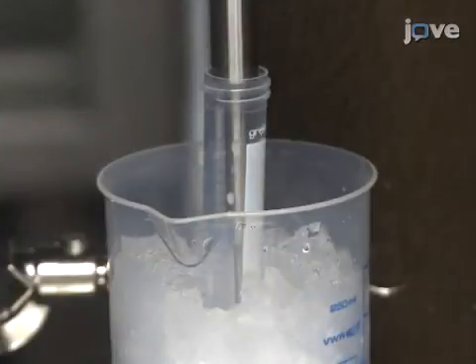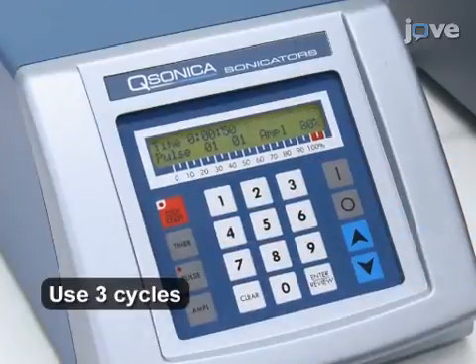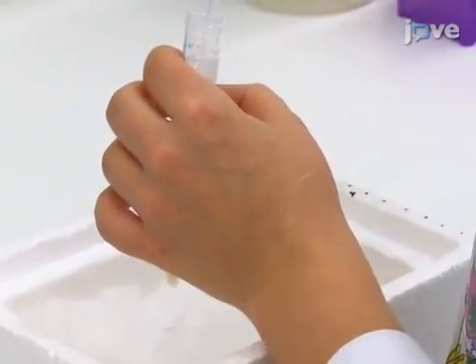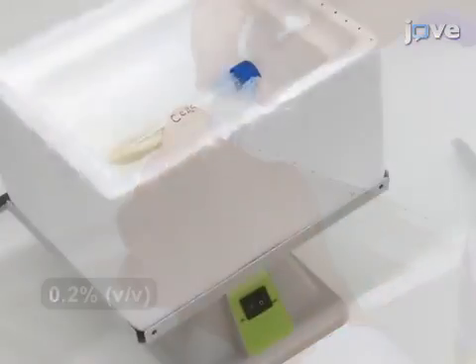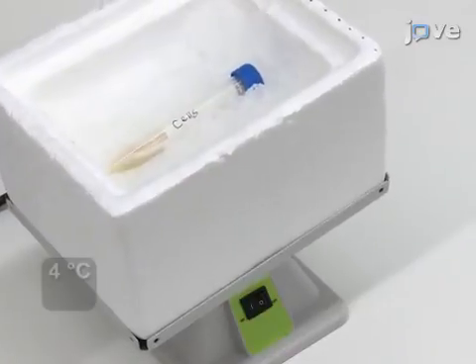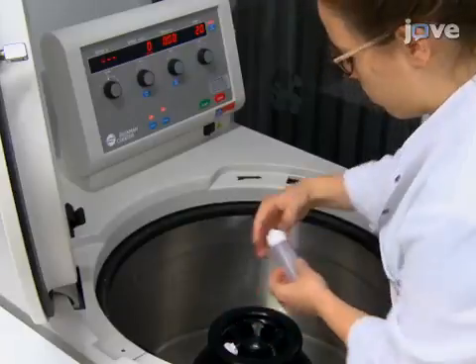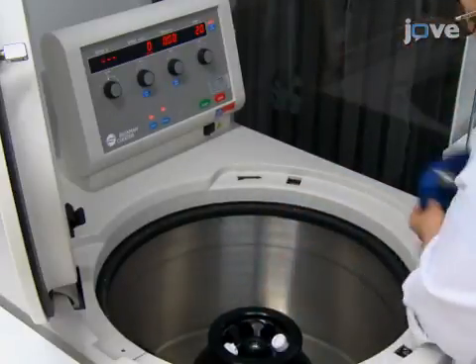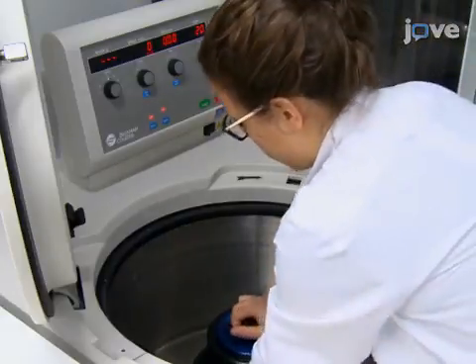Then, lyse the resuspended cells by ultrasonication with an amplitude of 80% and a pulse of 1 second on and 1 second off. Use 3 repeating cycles of 50 seconds each. Add detergent buffer to a final concentration of 0.2% detergent. Equilibrate by end-over-end mixing at 4 degrees Celsius for 1 hour. Recover the membrane protein fraction by saving the supernatant after a single centrifugation step at 39,000 g for 50 minutes at 4 degrees Celsius.